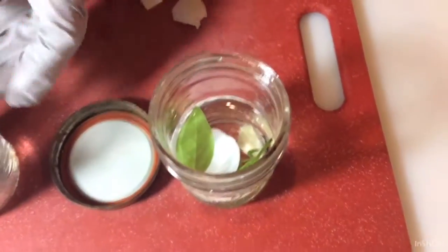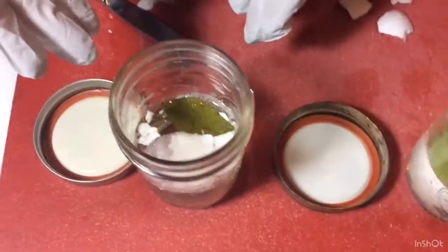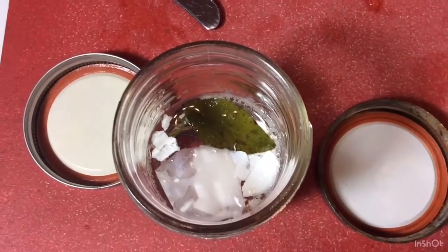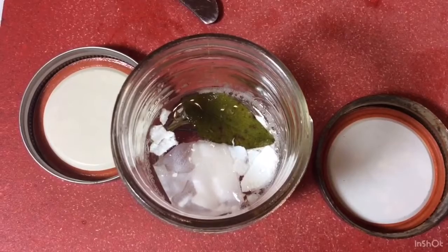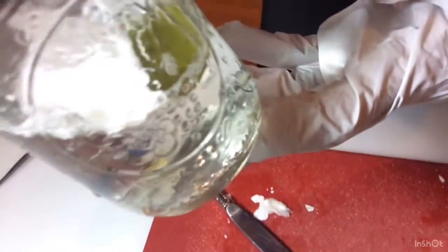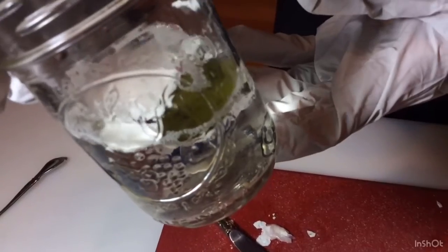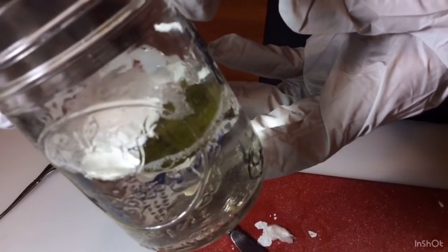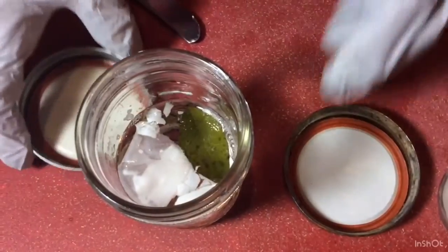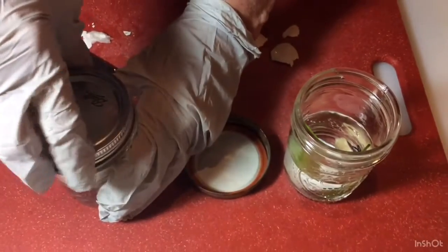Again, another thing you might notice back on the vinegar is how it's foamy. That came about because the fossil was being eaten or degraded, dissolved by the acid, and it's much smaller. We'll look at how much it's changed at the end of this experiment, but you can see how much it's gone down, how much smaller it is compared to the one in the water. So we'll come back again later.